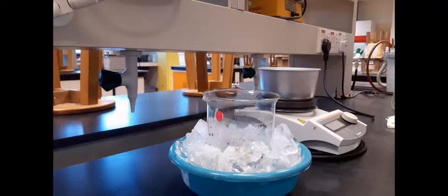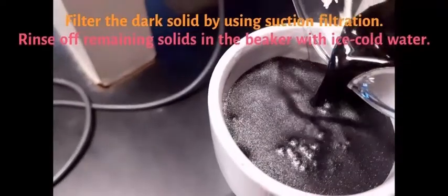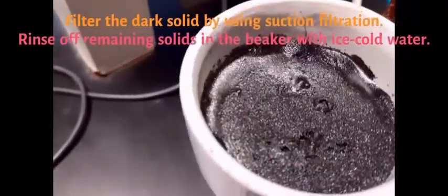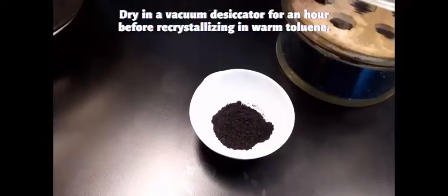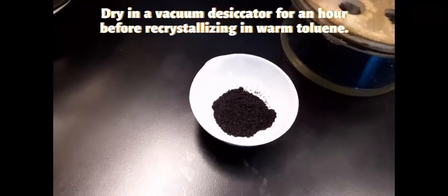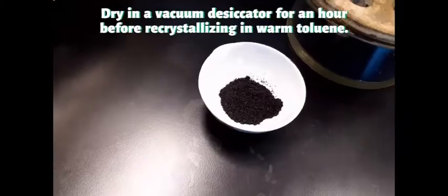This solid will be dried in a vacuum desiccator over anhydrous calcium sulfate. Now we have our sample ready to dry in the vacuum desiccator for about 1 hour.